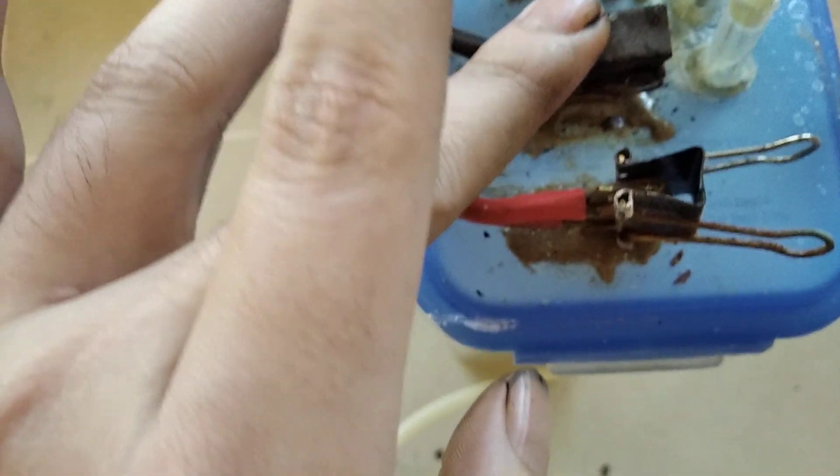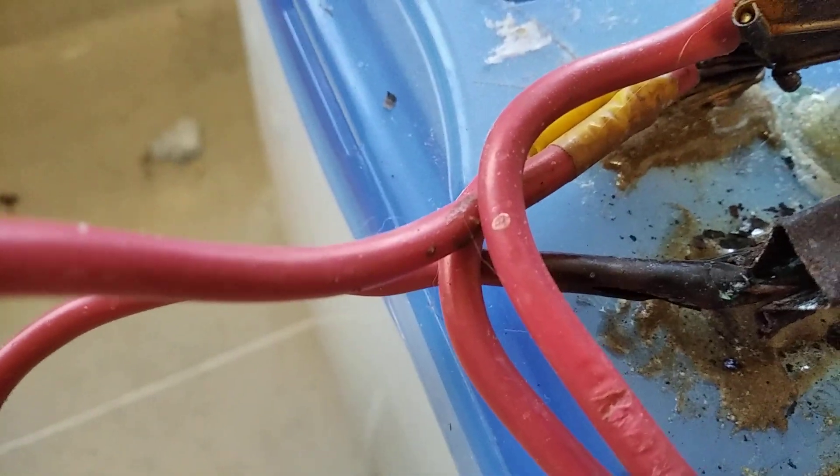And these bus bars, they're copper plated and they're holding well. They no longer burn you when you touch them because before, this wire is black because before the bus bars would get so hot that they'd flash evaporate steam.